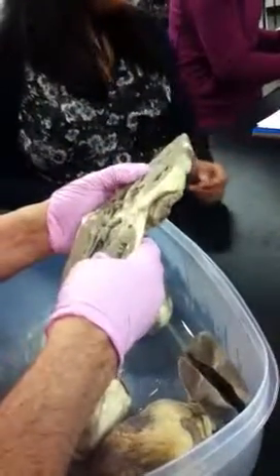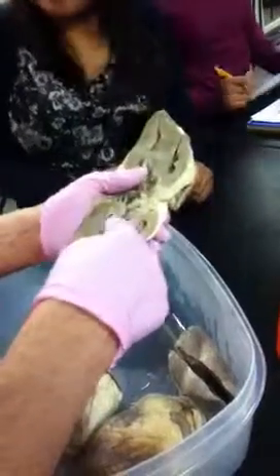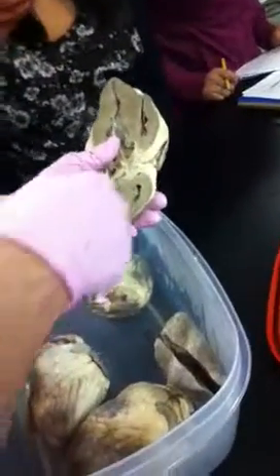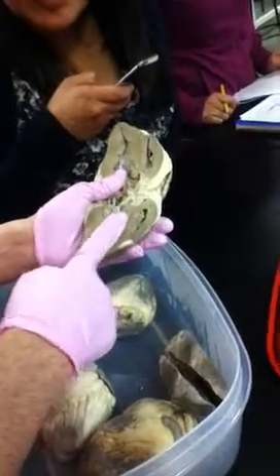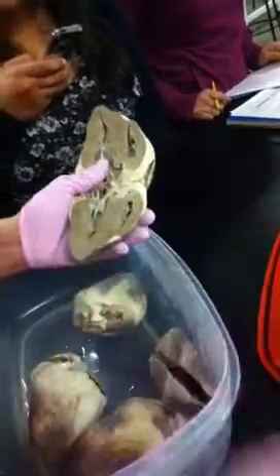So if it's gray, it's myocardium. If I pointed right here, I'd have to say, is this a layer of the heart, or what is this actual structure? The structure would be the interventricular septum. The layer of the heart would be the myocardium.